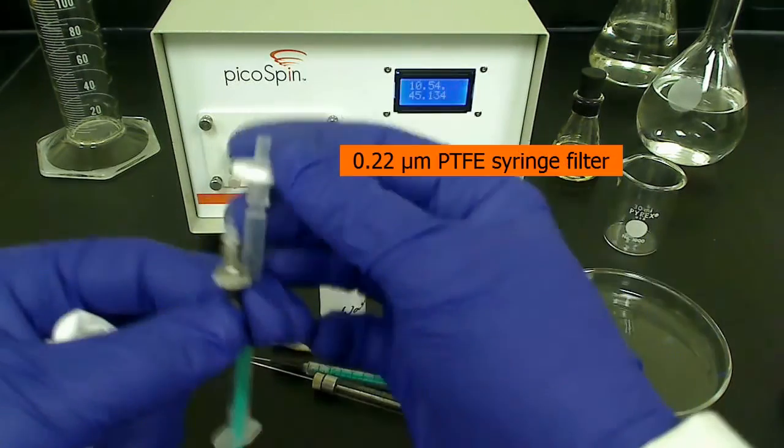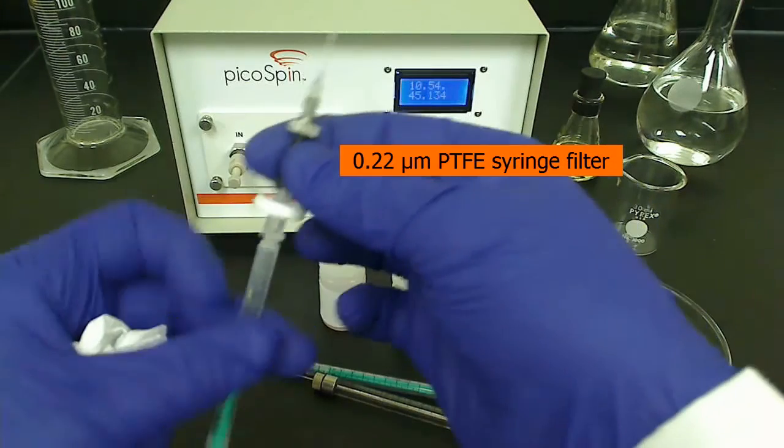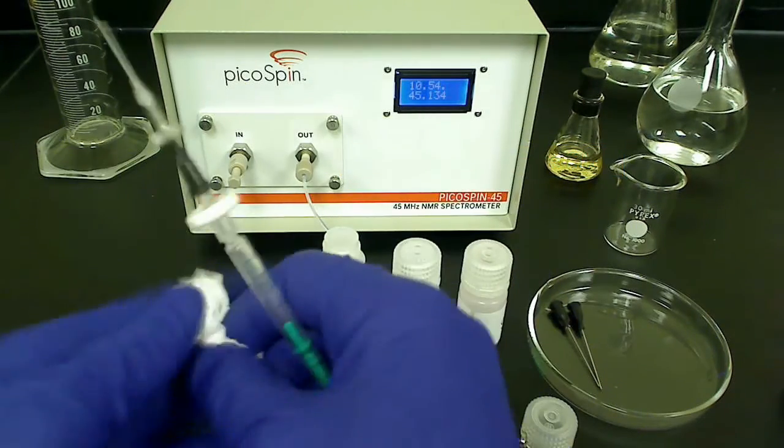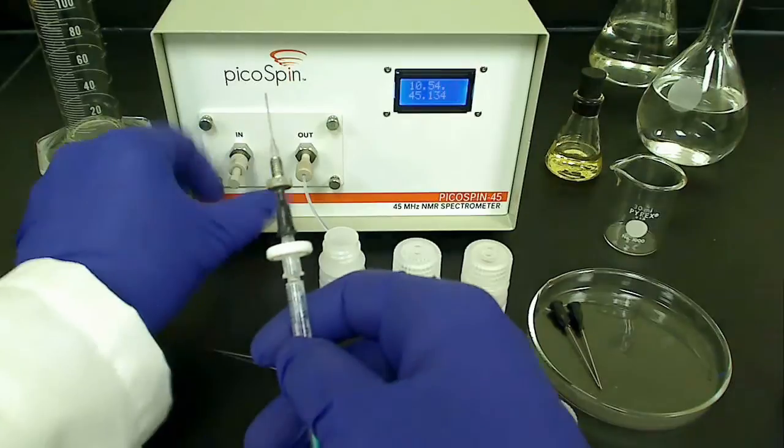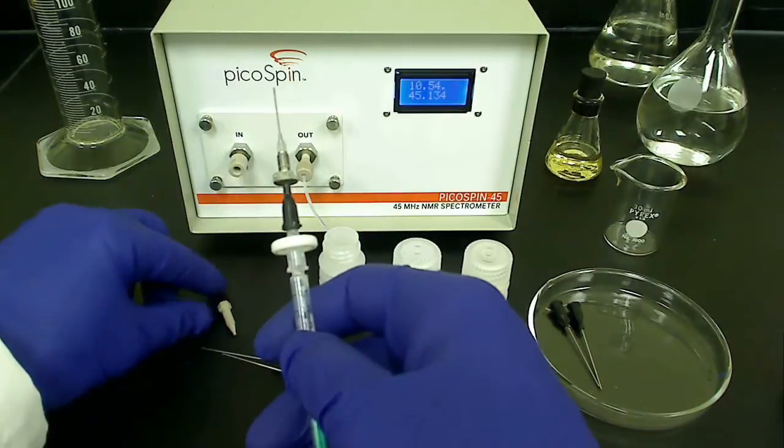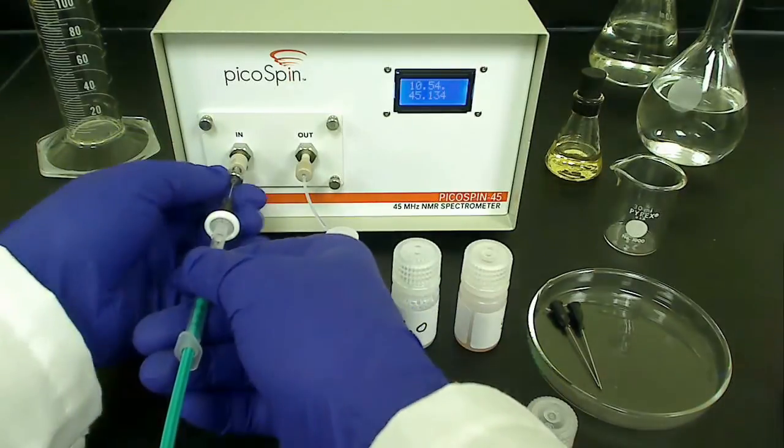The syringe filter I'm using is a 0.22 micron PTFE filter encased in a polypropylene body. This configuration is fairly chemically robust, but you should choose the syringe filter best suited for your chemistry.